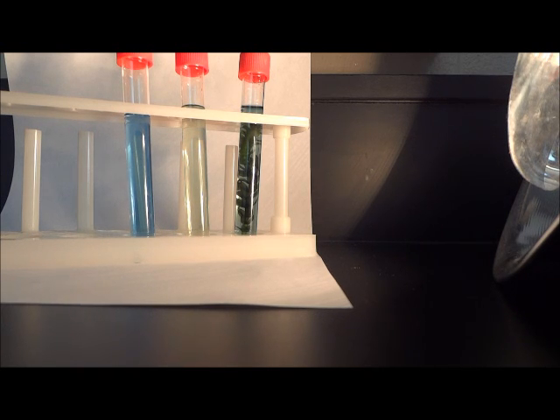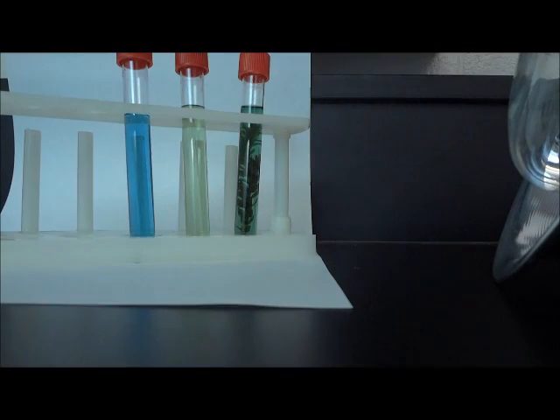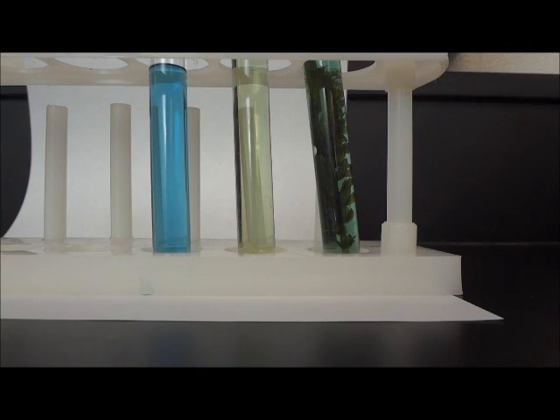It has now been 24 hours. The test tubes have stayed in front of this light for the entire time. Now, let's go ahead and observe the changes. Here's what the test tubes look like after sitting in front of the light for 24 hours. In order to see the test tube with the Elodea better, I'm going to turn it over so that we can just focus on the color.